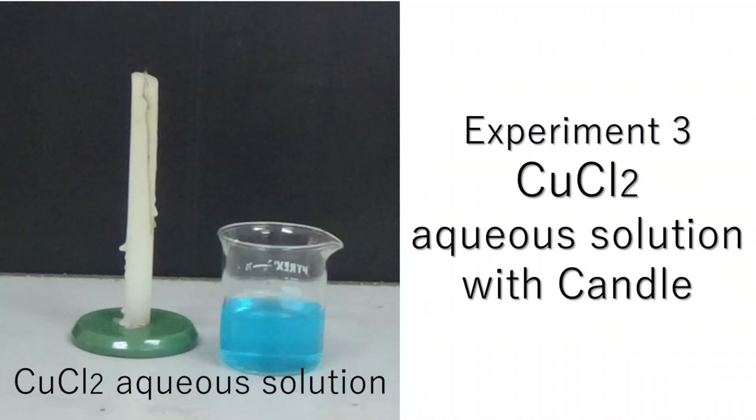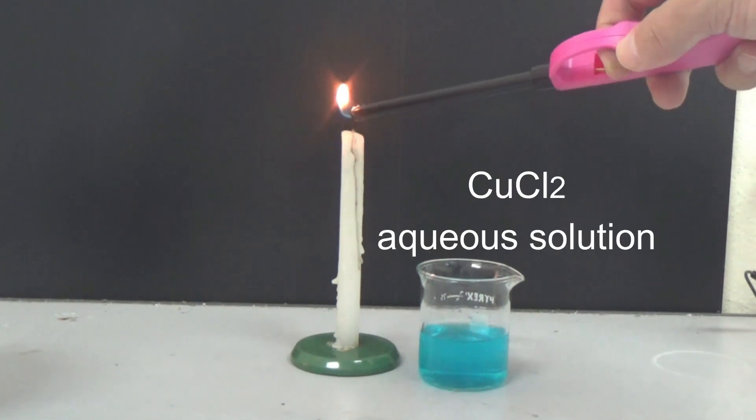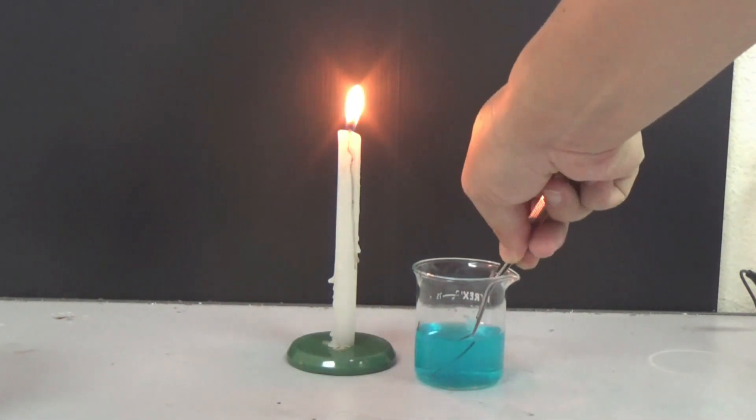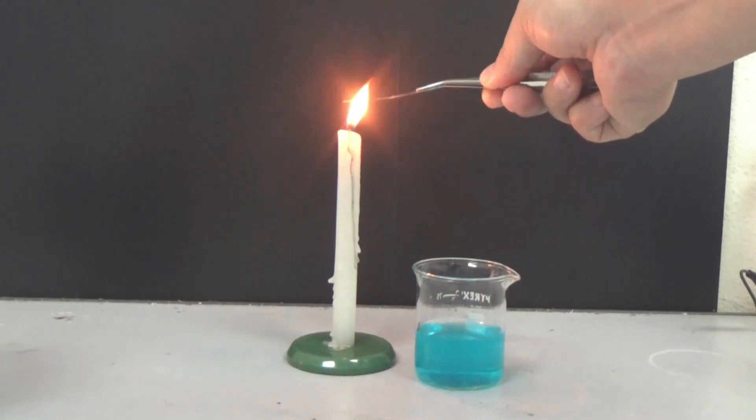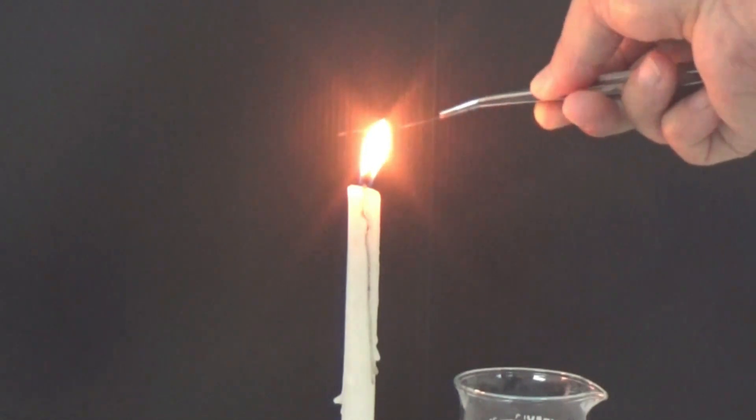Let's confirm whether the flame reaction of copper can be observed with a candle. The combustion temperature of a candle is low, so no flame reaction occurs.